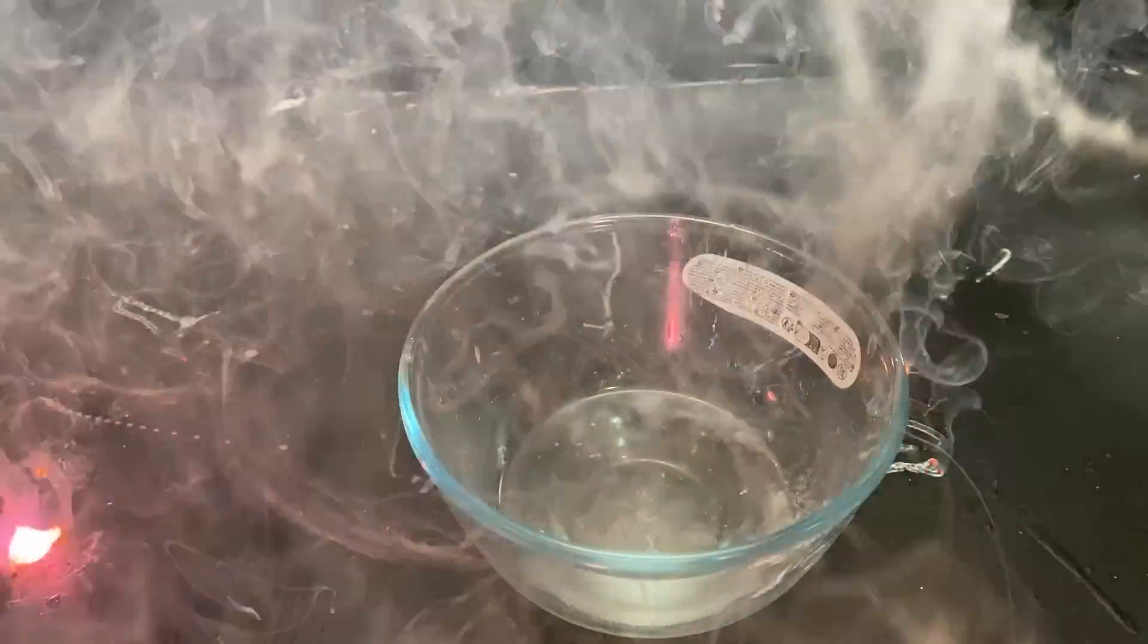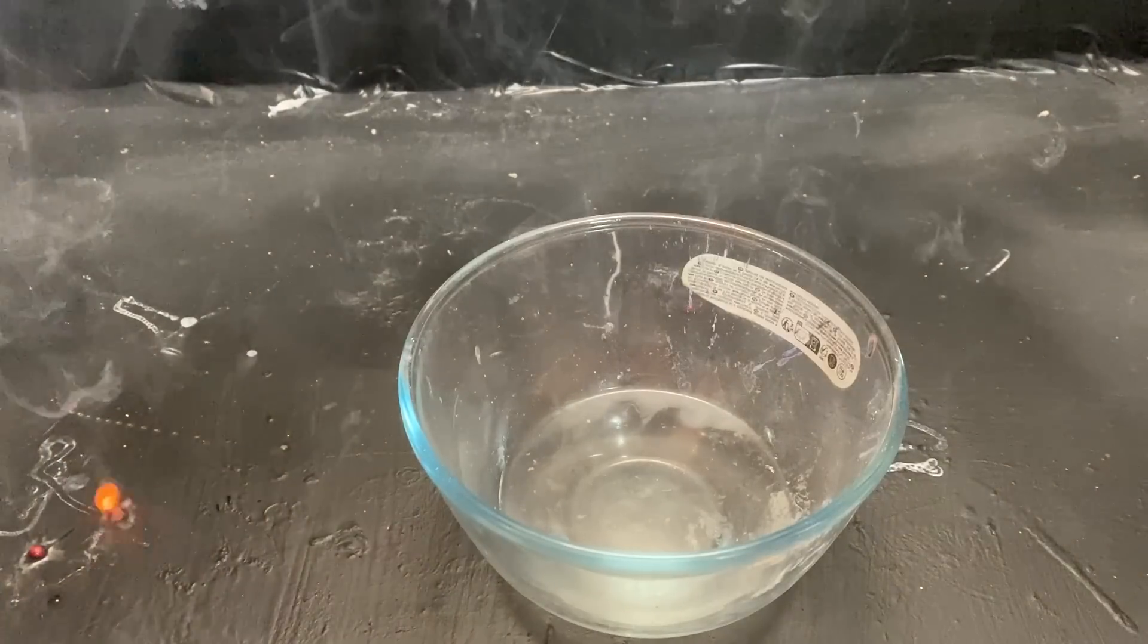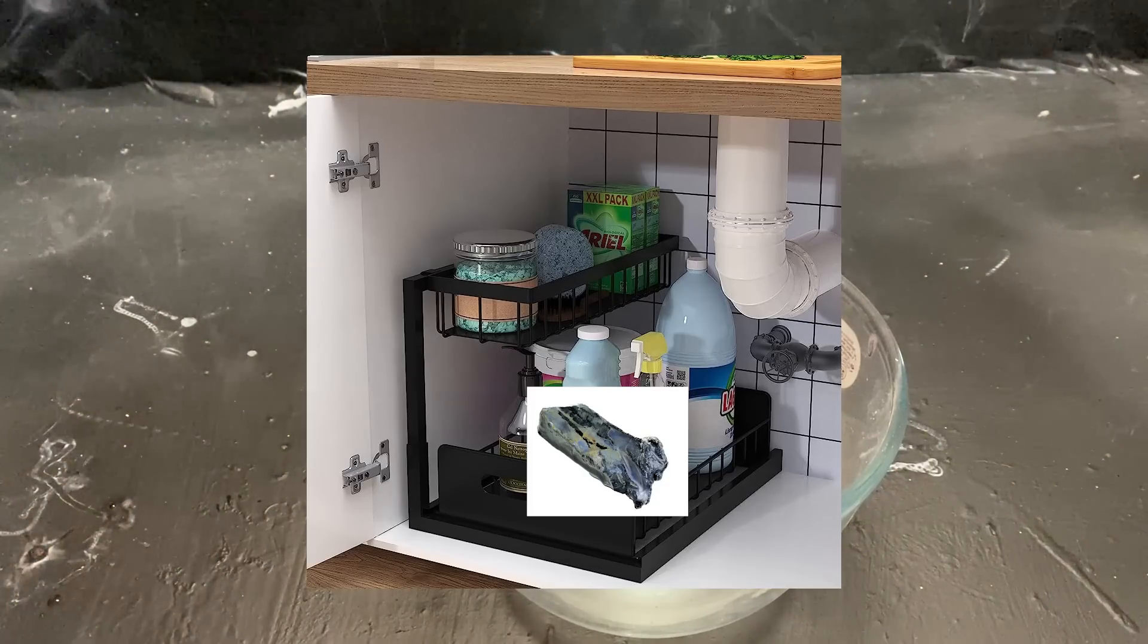Well, that was cool, but I guess my workbench would disagree. So please don't do that at home, in case you find 100 grams of potassium under the sink.